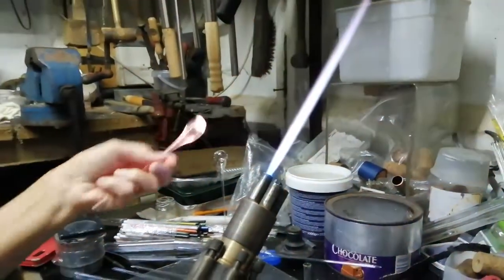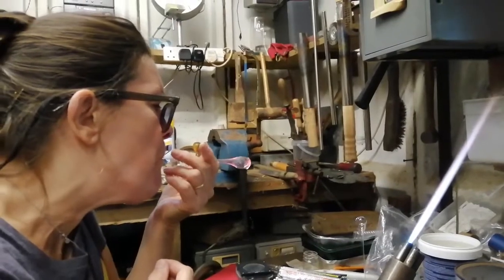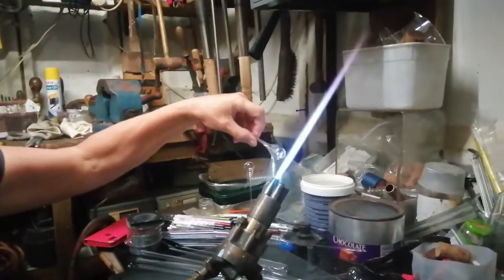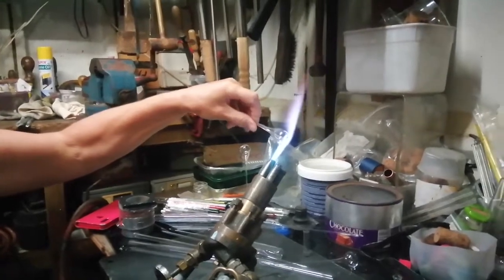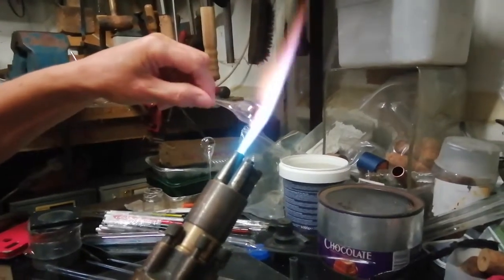Take it out and give it a little blow. Keep turning as you go. Excellent. So nice easy turning, heating just onto the shoulder so that the thick part is just coming through the flame.